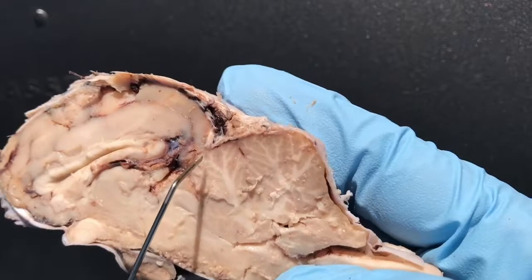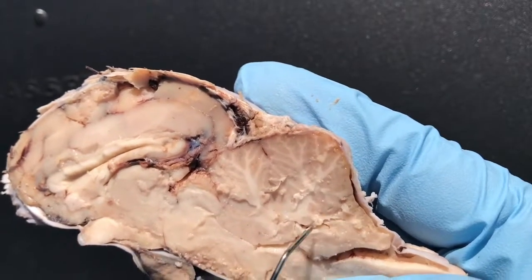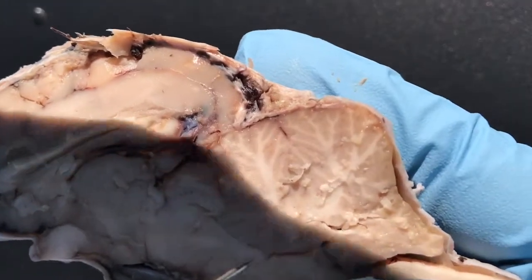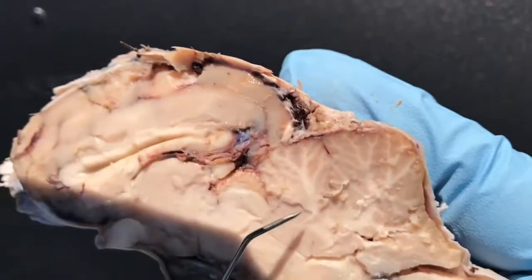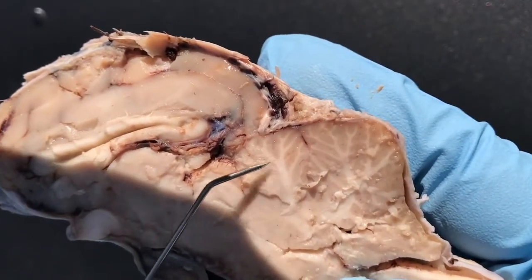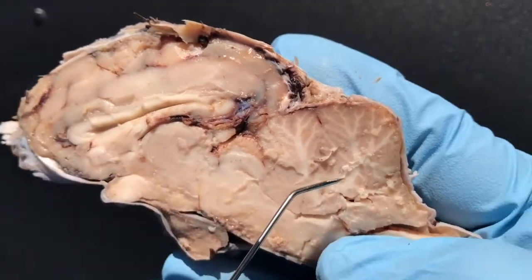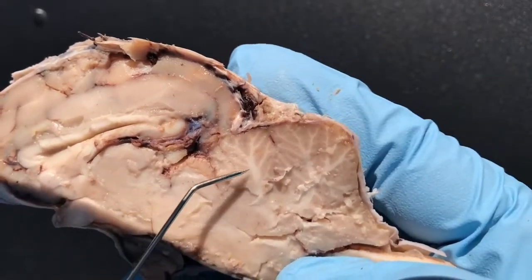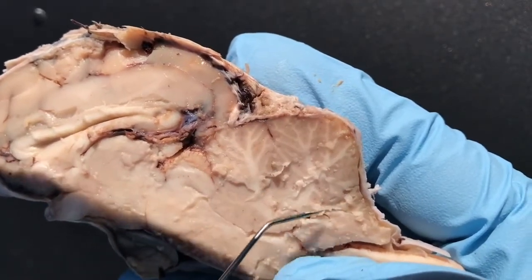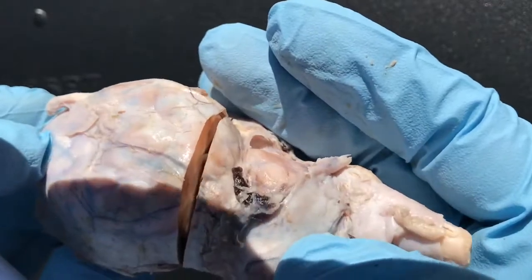This structure here is not the cerebrum — this is the cerebellum. And if you notice, you have your tree of life. This is the arborvitae. This white matter here — you see that? That's arborvitae, that white matter. All that is inside of this structure called the cerebellum, right there.